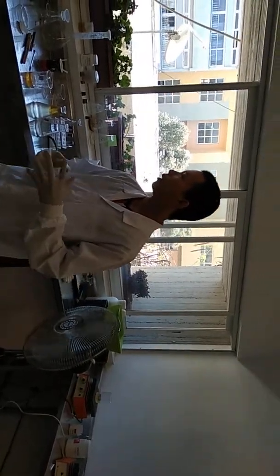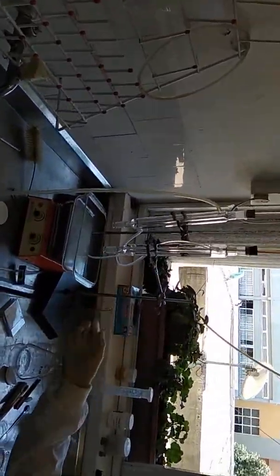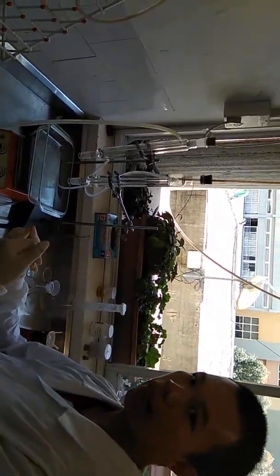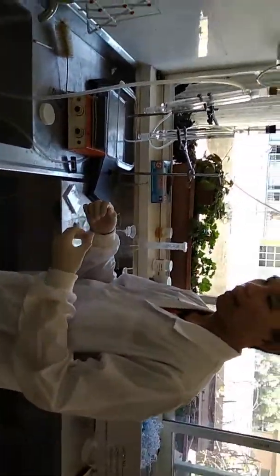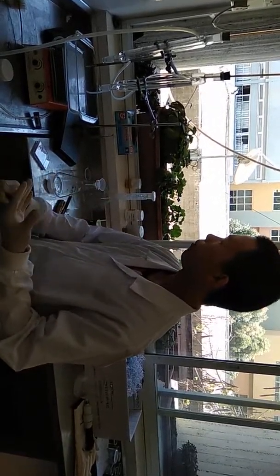So my system is kind of simple. I use this reflux system to boil up a combination of isoamyl alcohol and acetic acid, and put in an amount of catalytic acid, which I mentioned above, using different amounts of catalytic acid to see how different the products are going to be. That's what I do. So I boiled it up and kept it stable at a temperature of 140.